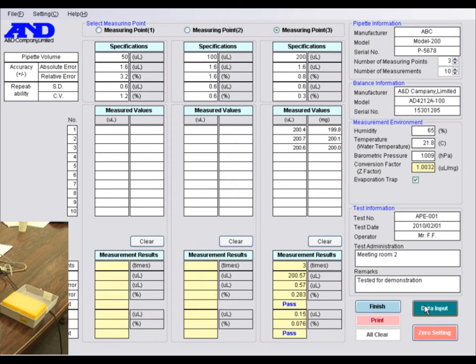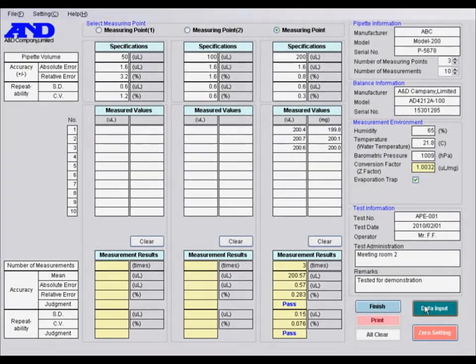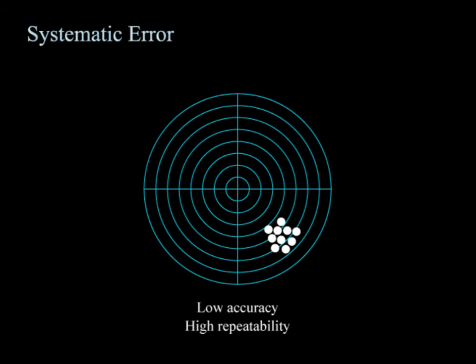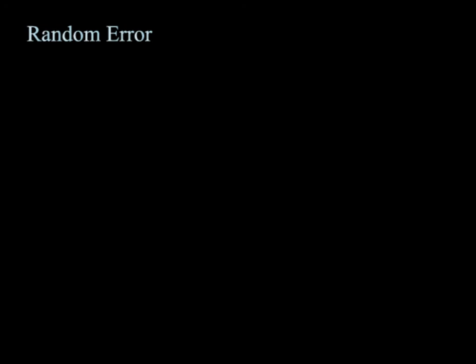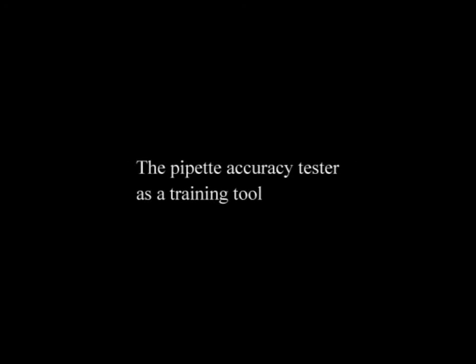When you have completed 3 measurements, WinCT Pipette starts to show the judgment results for accuracy and repeatability. The accuracy results indicate the systematic error of the pipette, which is the deviation from the true or target volume. The repeatability results indicate the random error of the pipette, which is the variation in repeated measurements. Apart from the performance of the pipette itself, these errors are greatly influenced by operator skill. Therefore, novice pipette users can also use the pipette accuracy tester as a training tool.